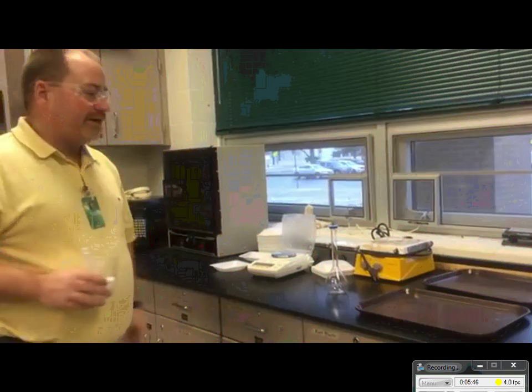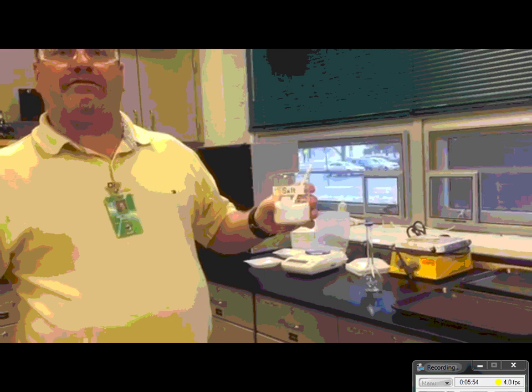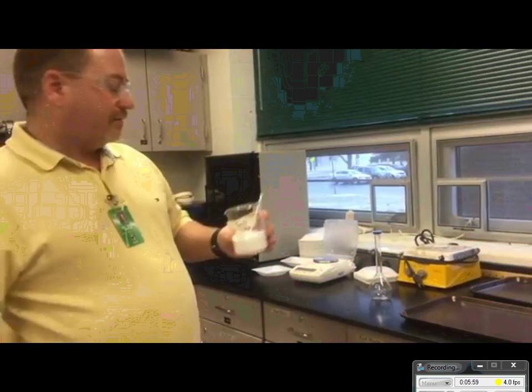So what we did earlier in class is I showed you the calculations how to make 250 milliliters of the 2.5 molar solution. So now what I should make. I need to know a certain amount of grams of my sodium chloride, which is the salt I have in my hand. I need 36.53 grams. So I'm going to turn on my scale.